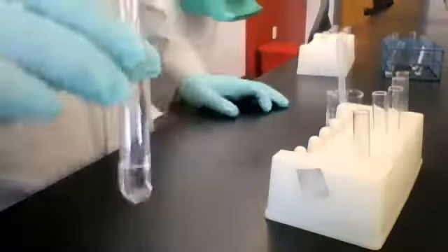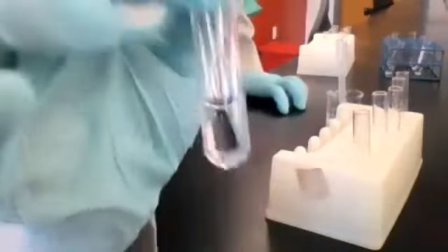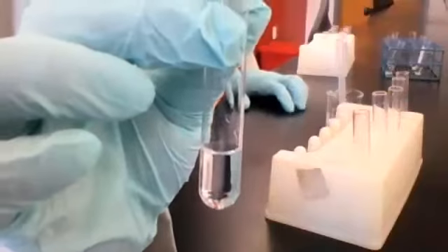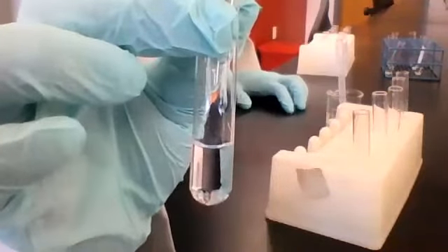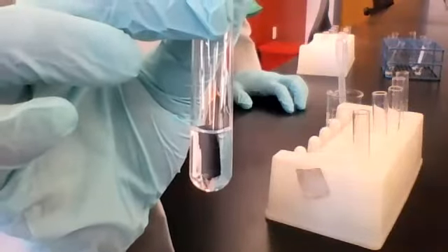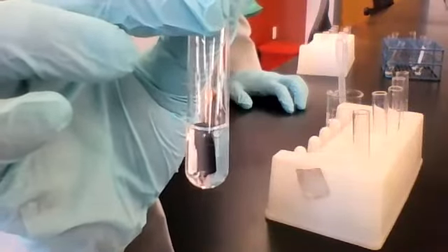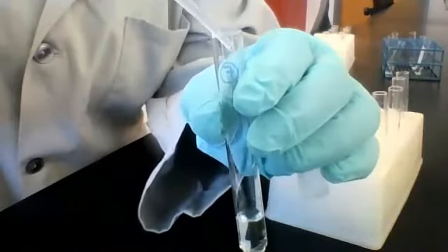Okay, our next test solution is water. I want someone to make another prediction here. Do we think anything's going to visibly change when we add HCl to water? When we add an aqueous solution, that is, of HCl to water? No, ma'am. Please don't call me ma'am. All right, let's see if we're right.